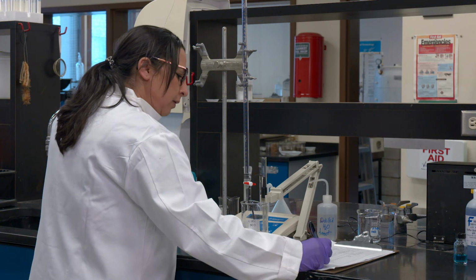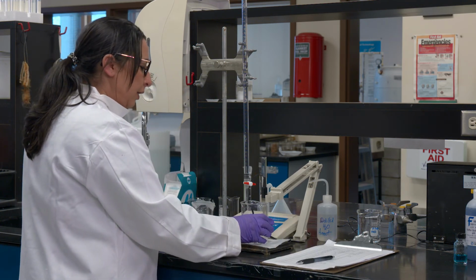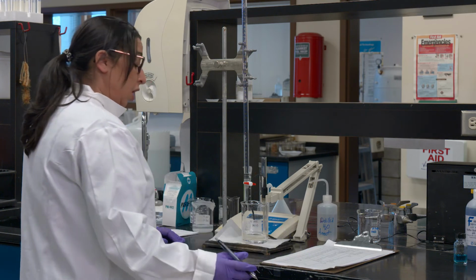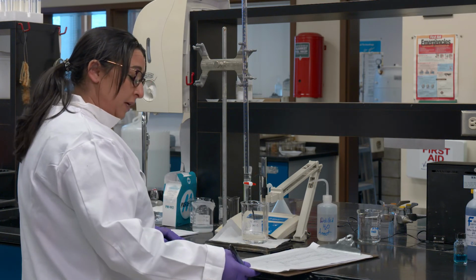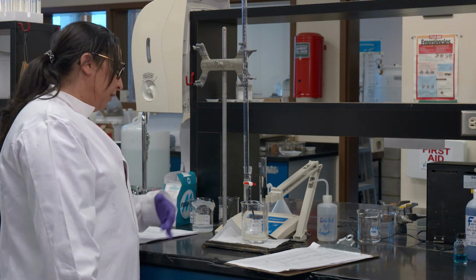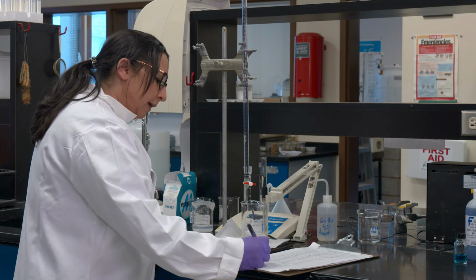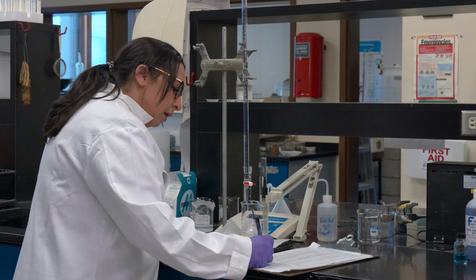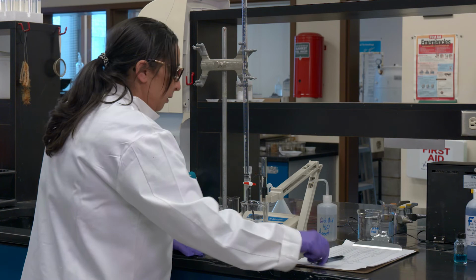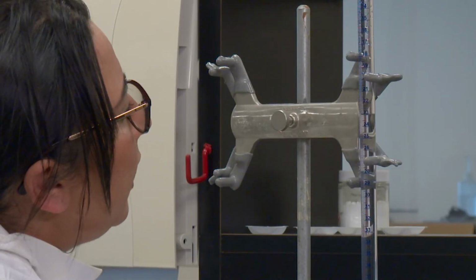So another 3 ml. So far we are approximately at 33 ml. And we are already into the zone of pH 4. So I'm at approximately 4.7. I will wait for it to give me a ready button, and I'll enter the final value for that. Okay, still at 4.3. Remember, we have to reach 3 or below 3. So still more readings.